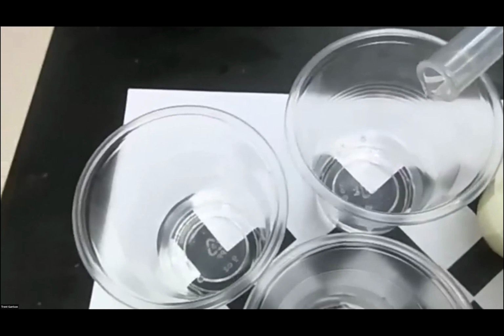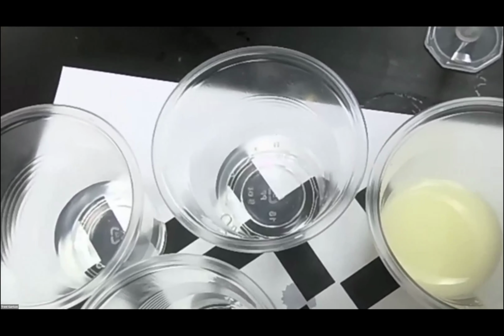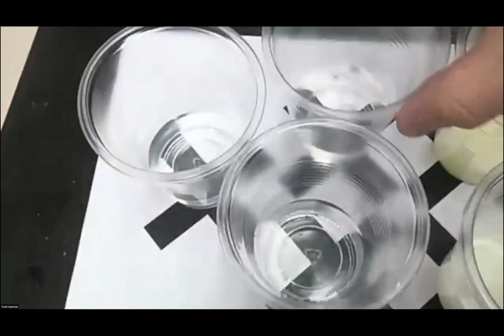So I have measured out my 5 milliliters, and I have zeroed out my stopwatch. So I'm going to pour in my 5 milliliters for a third time. I'm going to start my stopwatch. And we will watch, and then hopefully we'll see that this one goes a little bit longer than 30 seconds before we can no longer see that X.